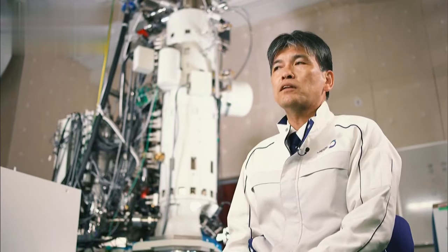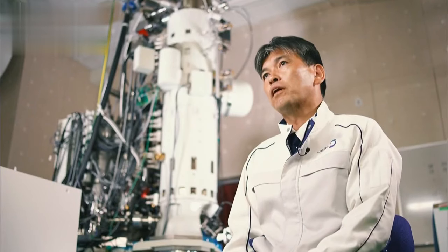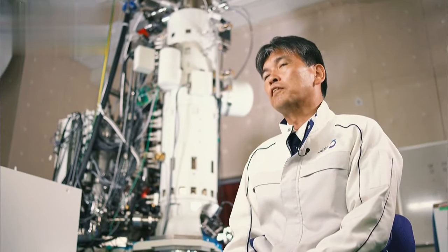A microscope that uses visible light is called an optical microscope. An electron microscope, on the other hand, aims an electron beam at the sample, allowing you to zoom in from several hundred thousand times to several million times magnification.